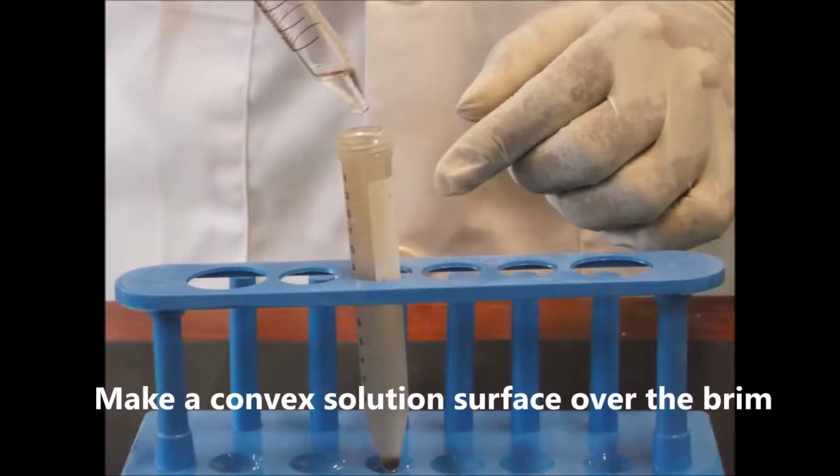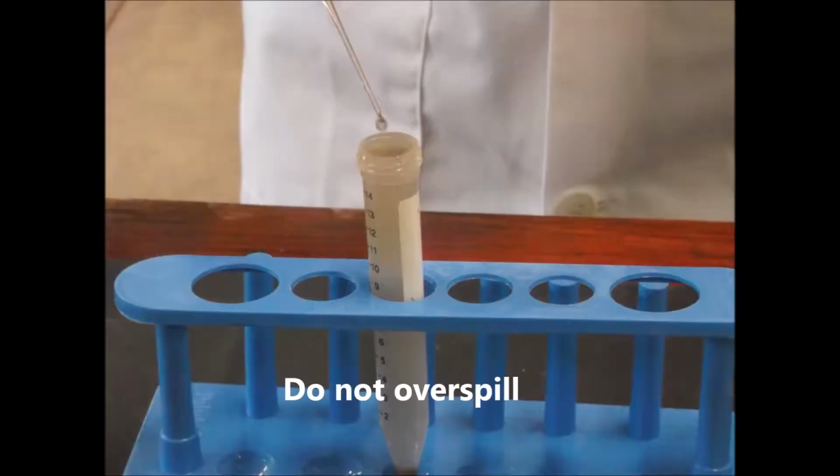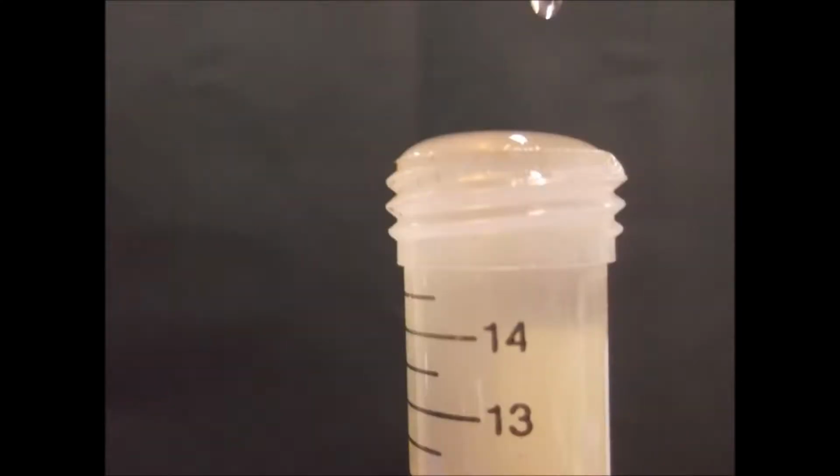Add the final drops using a pipette to give a convex solution surface over the brim. You must take care not to overspill. Your preparation should have a convex surface like this when observed from the side.